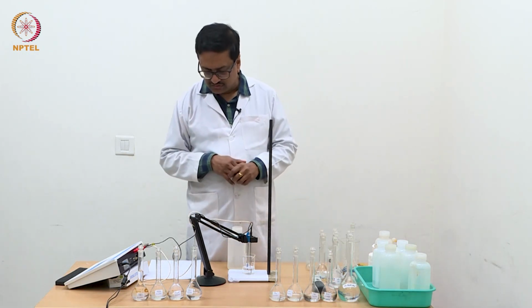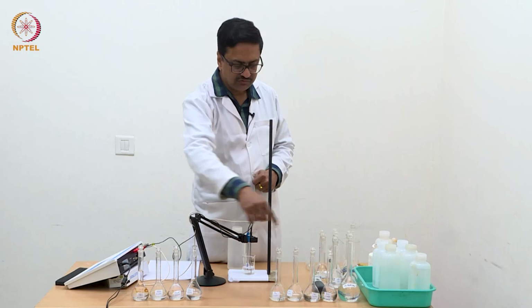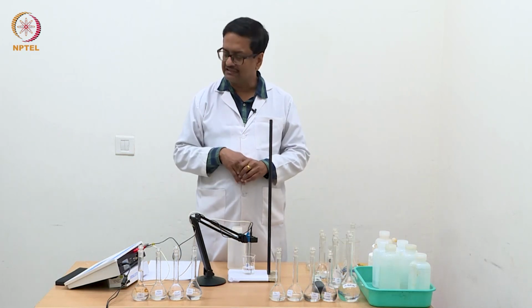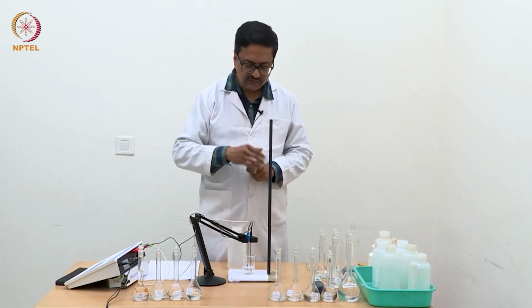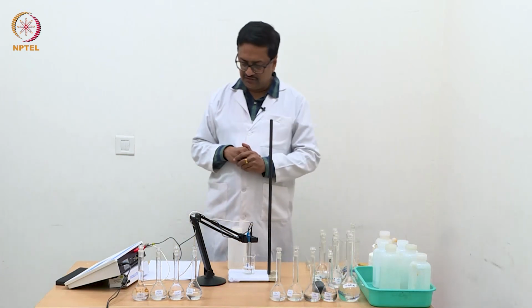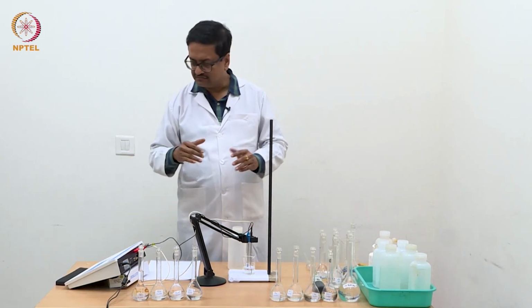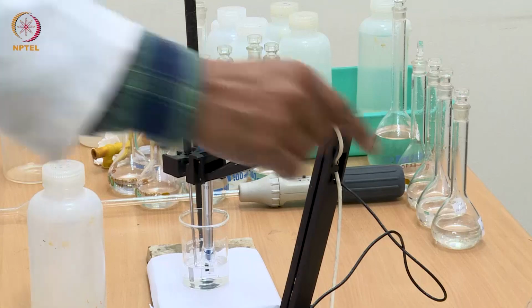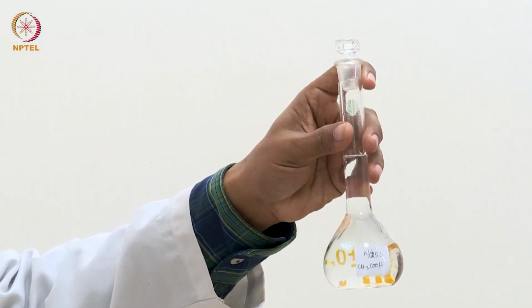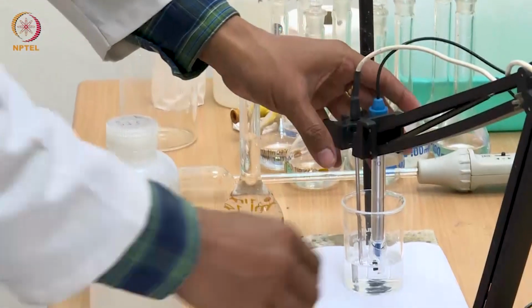Now I am going to use these dilute solutions from left to right, which is from the most dilute to the most concentrated, one by one, as before, which we have done for HCl. We will do the same with these acetic acid solutions and take the reading of conductance for all of them, and then we will plot the equivalent conductance versus square root of concentration afterwards. So let us start by taking the N/256 solution, and then slowly I will go ahead with more and more concentrated solutions.